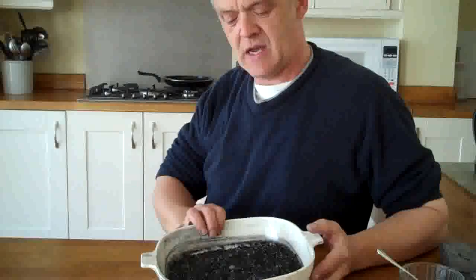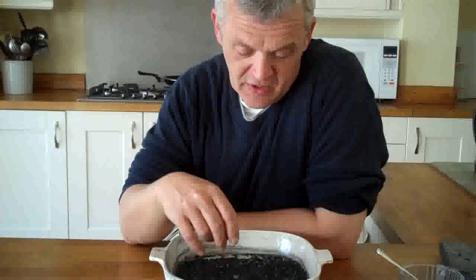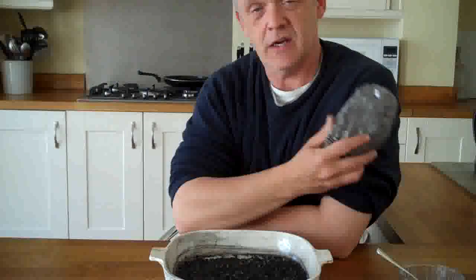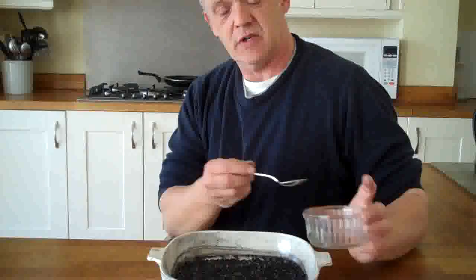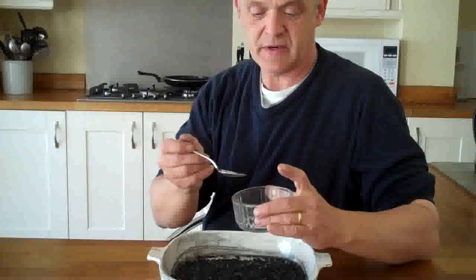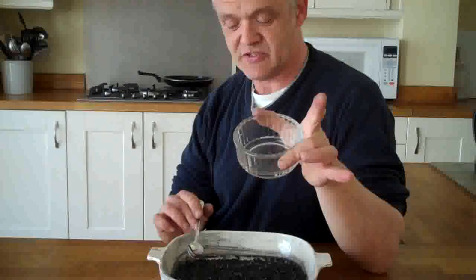Now, this graphite is intercalated. And it's been dried in the oven at 200 degrees for about an hour to make sure that it's really, really dry. Now, I've used this graphite from RS graphite that they sent me, this strange silvery stuff, and it could be the reason why this is actually quite spectacular. So what I'm going to do with it is just put a tiny amount into this Pyrex bowl. Now, there's about a quarter of a teaspoon in there. It's an absolutely minuscule amount.